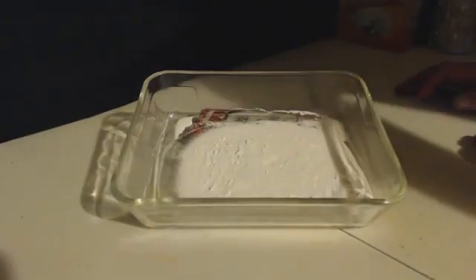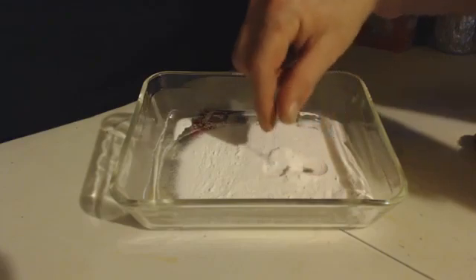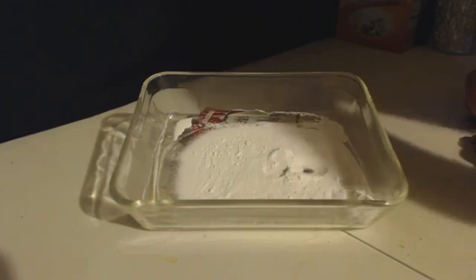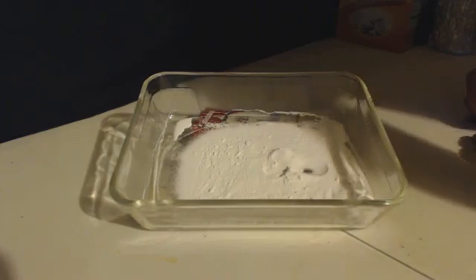I want you to see it's still the same texture, like flour. You basically can't even tell the difference between the baking soda and the sodium carbonate we just made. They both look identical.